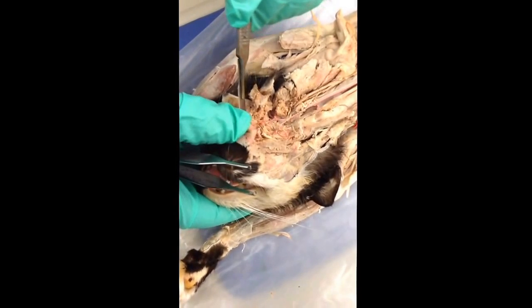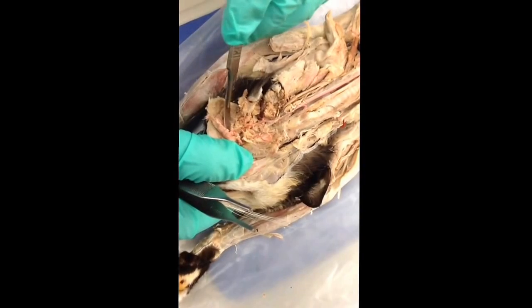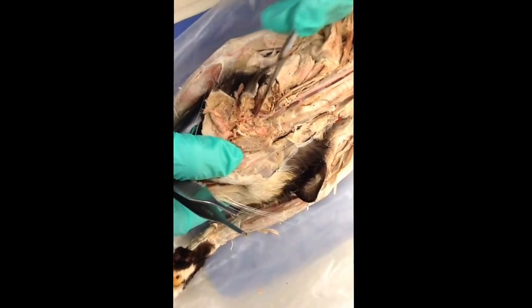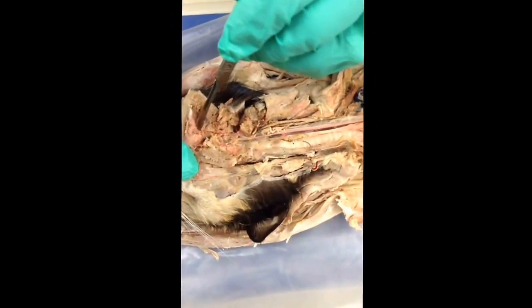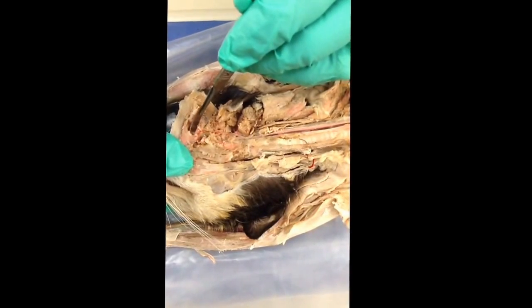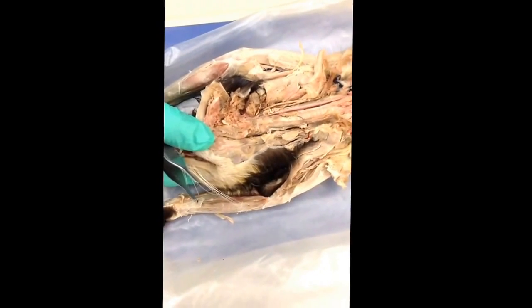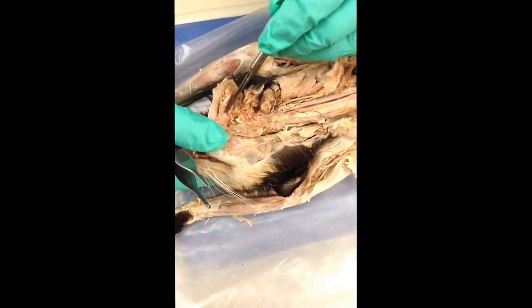The only thing I really emphasize on that, because you can kind of see it in some cases, you can get a forking around the jawbone. If you see a good forking, a fork going around the jawbone, which is not all that great here, that forking around the jawbone, those would be labials. I thought it was a little better. There's a fork maybe up there. It's not the best, but that's what we look for up there, okay? And I'll just have to try to find you a good fork around the mandible for labials.